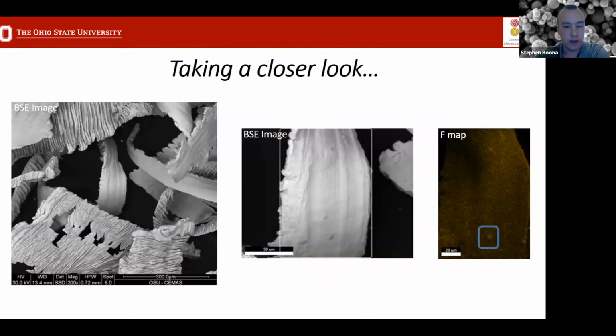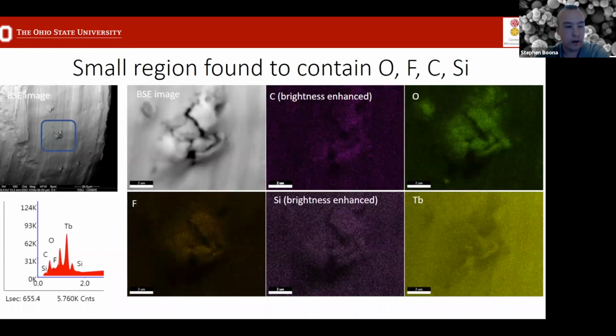So you can zoom in on that. And when you look more closely at that surface, you see there are some features that appear to have maybe a little bit more fluorine than they should. And then again, zooming in, you find that there are sort of these 5-micron bubbles on the surface that do indeed show a fluorine peak in their spectrum. And so now you can track down the origin and say that the contamination comes from the precursor material and not from some other step in the film growth process.